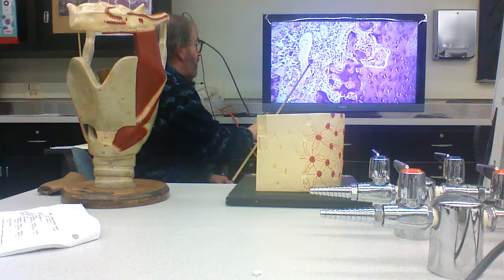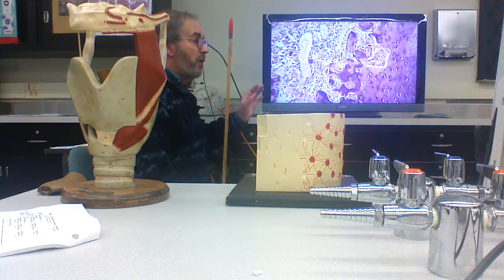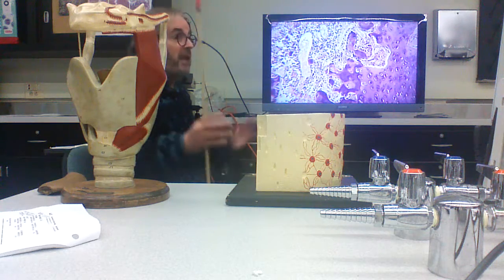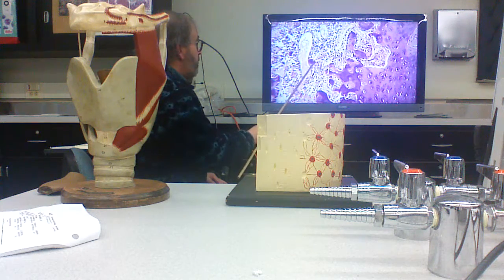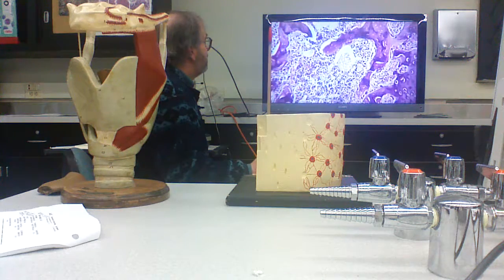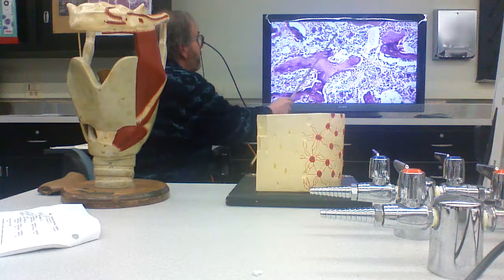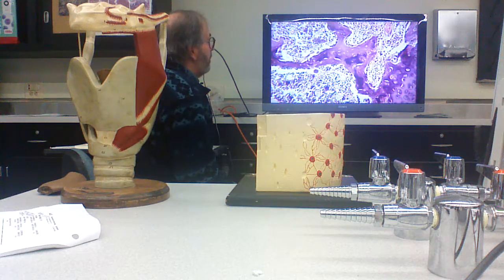This is not an osteoclast. It's a large cell. It's got a big nucleus, but only one of them. When we cover the cells of the bone marrow, you'll know that this is a megakaryocyte, which is Greek for a gigantic nucleus cell. And this cell is going to break up into little fragments, which are going to become blood platelets. And then all these other cells here are forming some kind of blood cell or other.